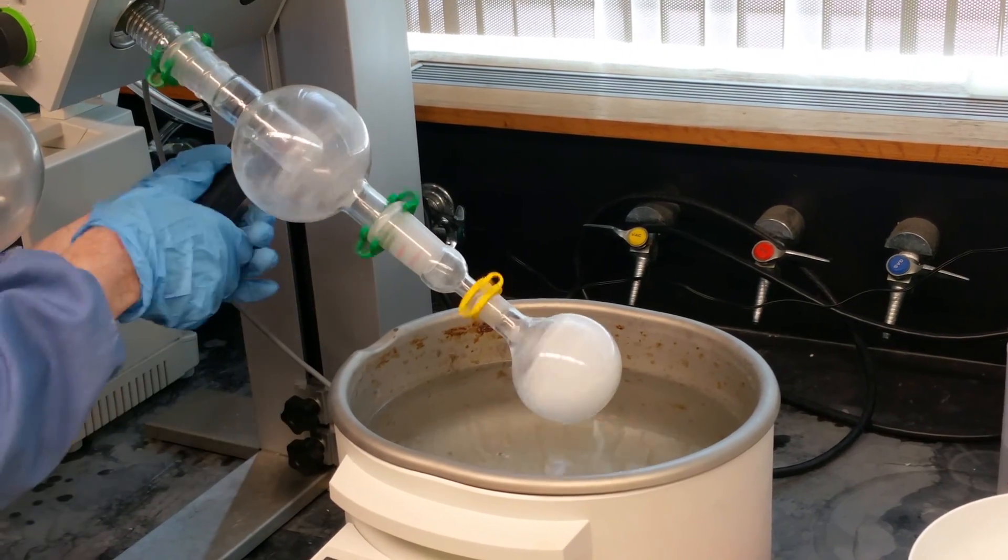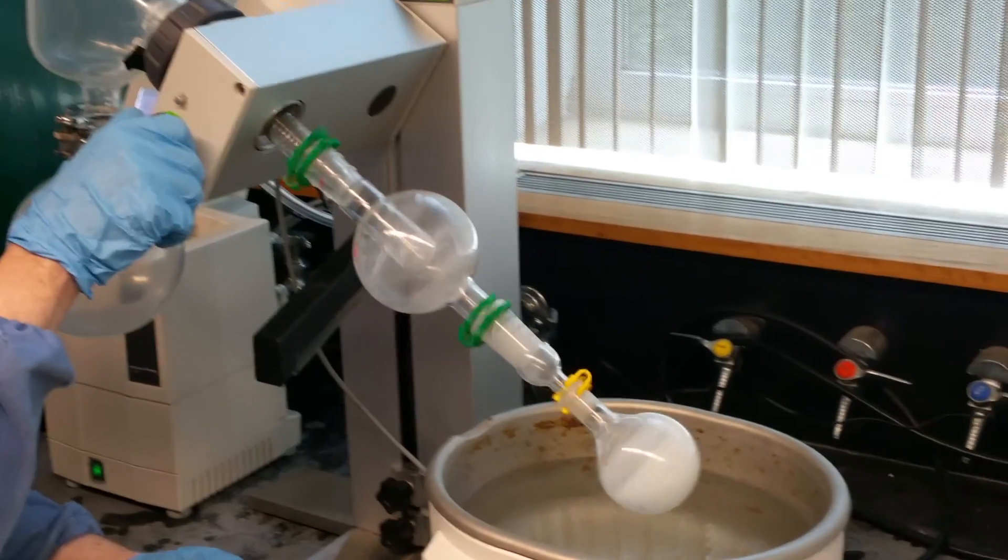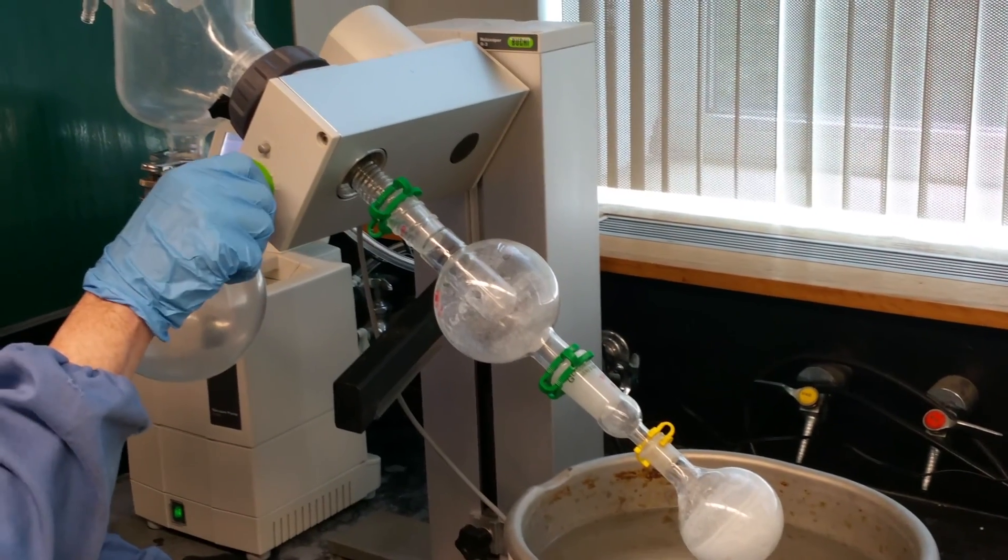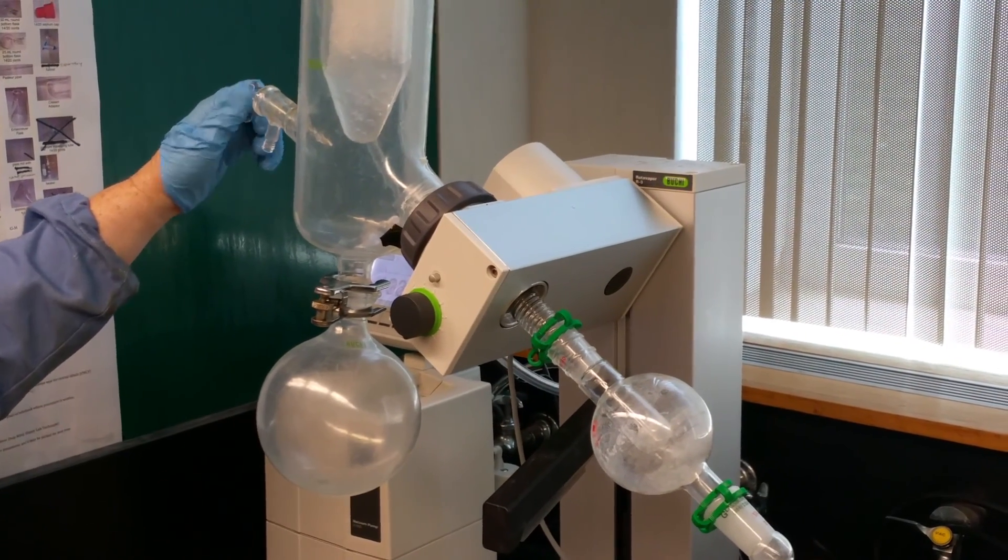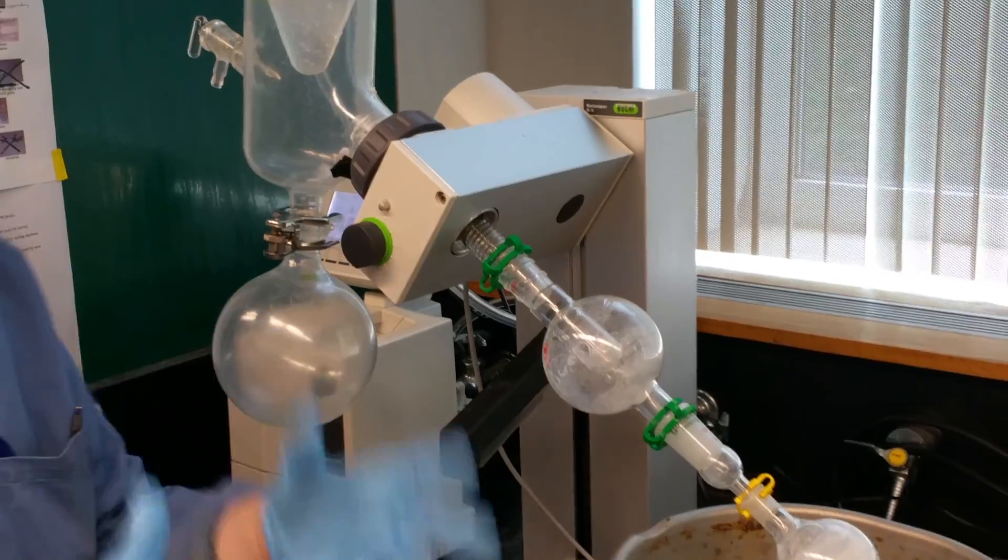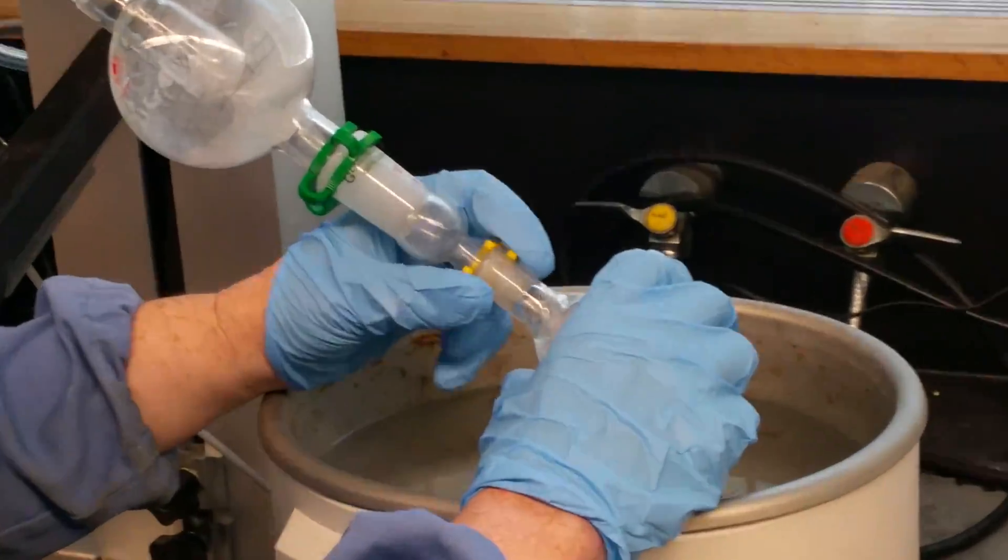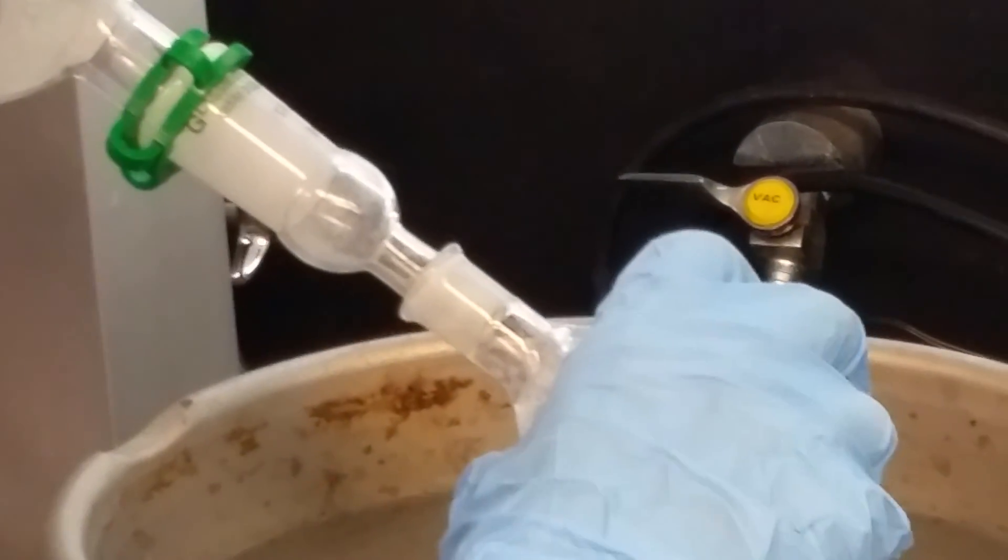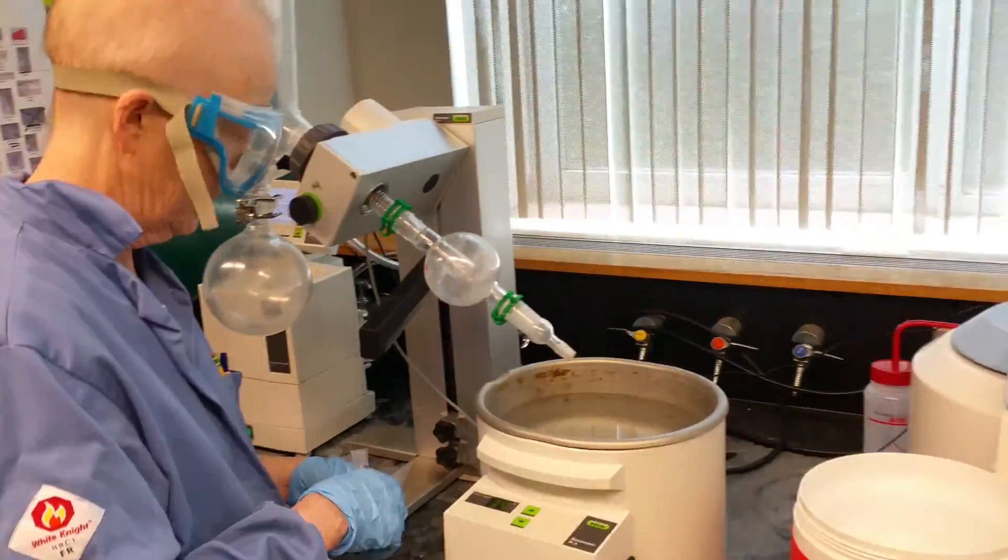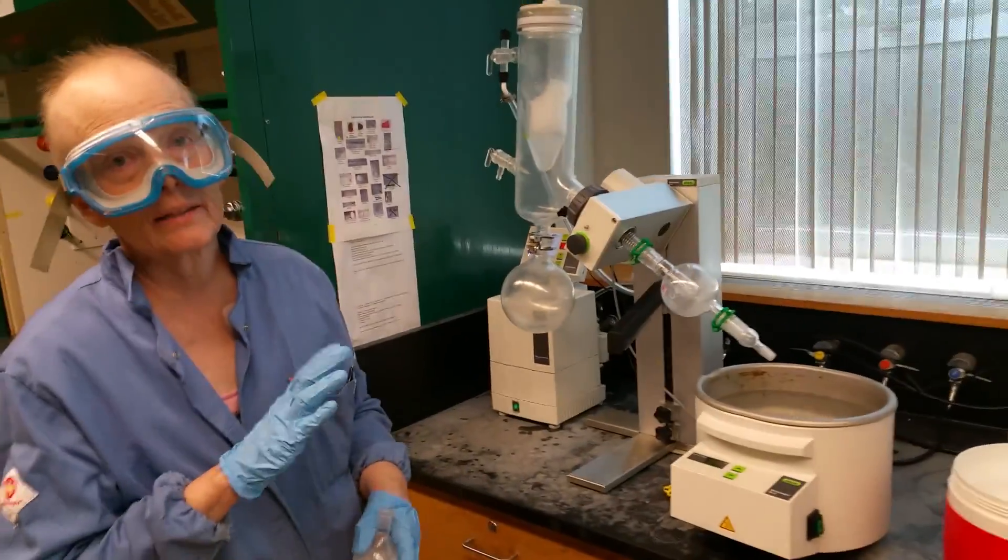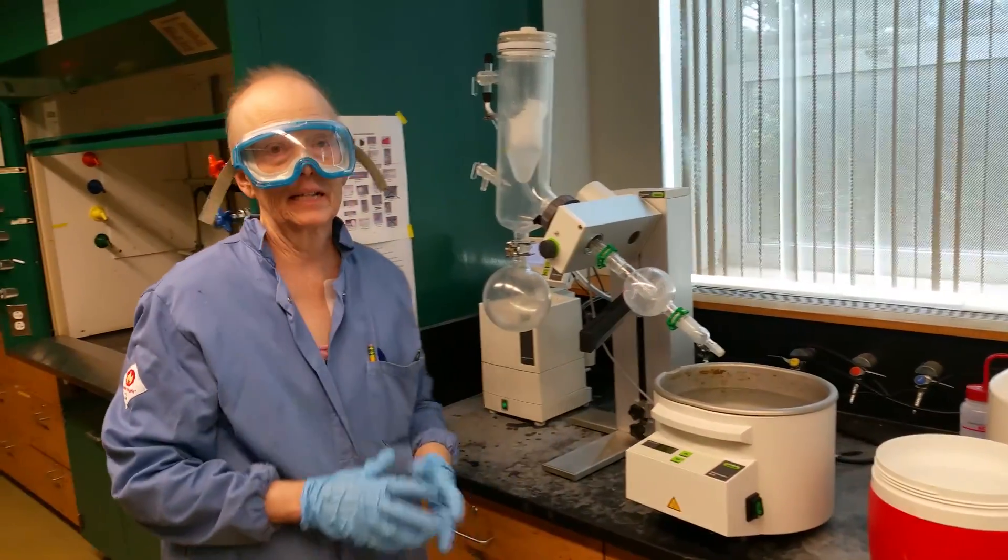What do I do? Lift it out of the water. You've got to squeeze this. Lift it. It feels like a jack. You close this. You turn this off. Stop it from rotating. I'm kind of an advocate of venting it for a second, then hit the stop button, because then it kind of comes down. It's starting to come down to atmospheric and it's not sudden. Then what do you do? You take the clip off gently. You give it a little jiggle and it comes off like that. I hope that made some sense. And the machine will be set up. Don't turn anything on or off except the pump. Thanks a lot. That's the end.